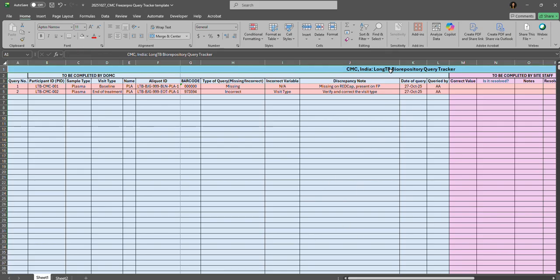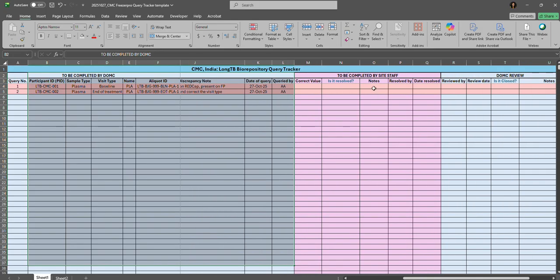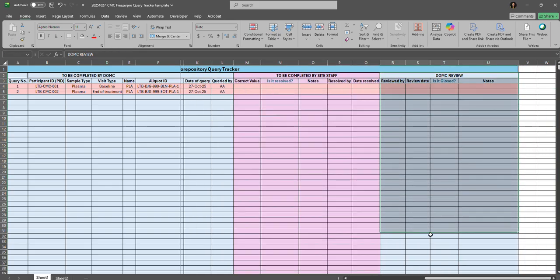Here I'll open the biorepository query tracker for the CMC site in India. That's indicated on the top. This log has 3 sections. The first section is to be completed by the DOMC, highlighted in light blue. The second section is the to be completed by site staff section, highlighted in light purple. The third section is DOMC review, which is also completed by DOMC, so it's highlighted in light blue.